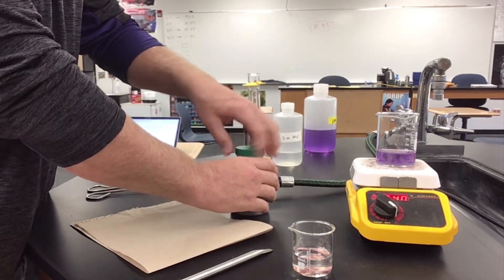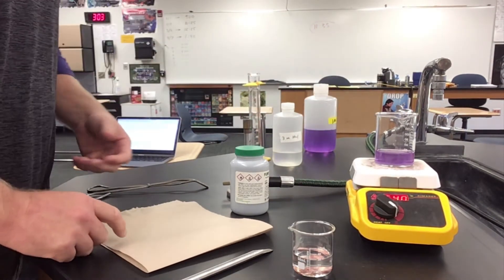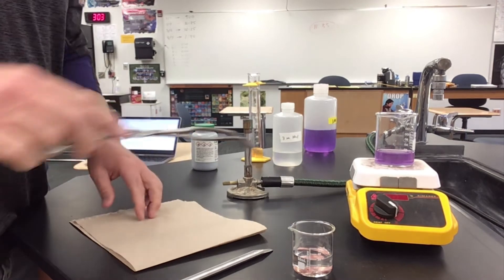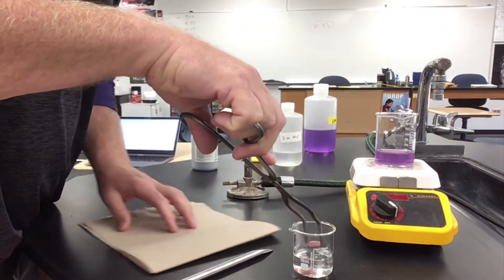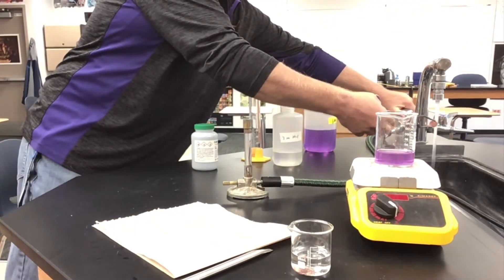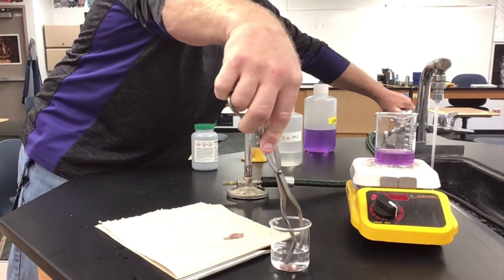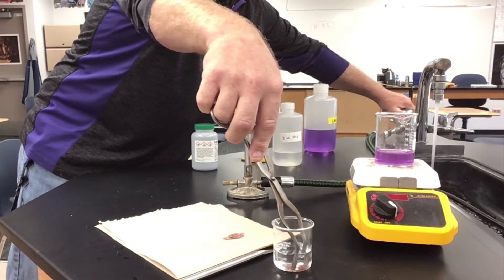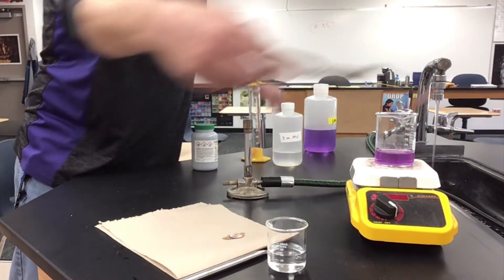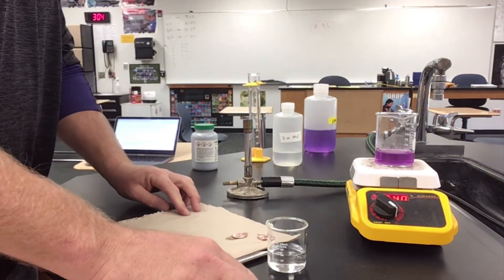We need to get this to heat up so it's boiling hot because the process we're going to do involves placing these pennies in it. I'm at my three minute mark now, so I'm going to remove my pennies and rinse them to get the acid off, and then set them down on my paper towel.